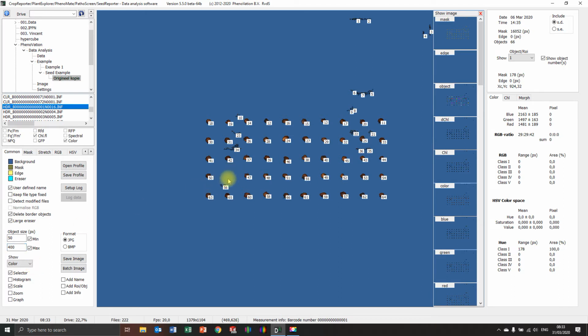Ooh, I lost the seed here. So 450. There it's back again. That's the biggest seed then, 411. So I'm going to put it on 420. I don't lose this seed, but maybe I lose some other parts, no, not that much.